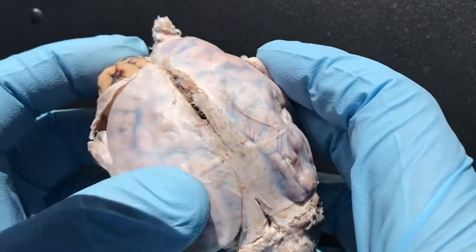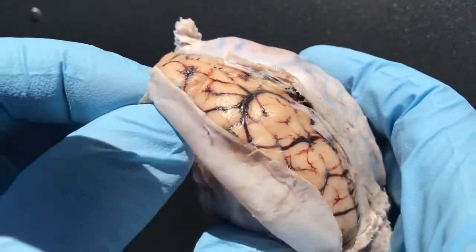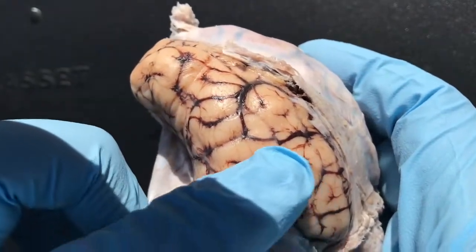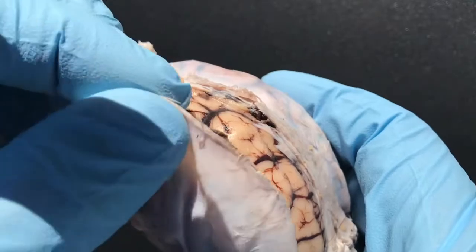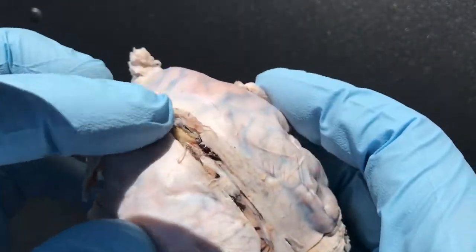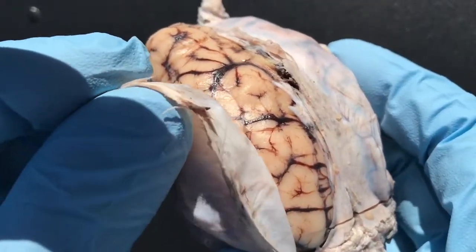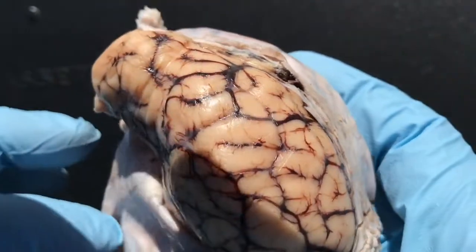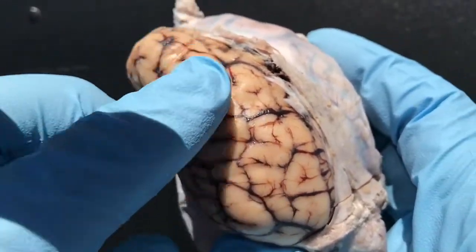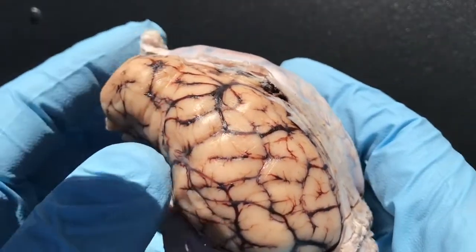Right off the bat, you notice there's this white layer here. This white layer is actually made out of two layers, and the third one is what you'd see here. So this white is actually the dura mater as well as the arachnoid mater. That's two layers, and then the third layer is the pia mater, which is this clear, very thin layer that you see here.